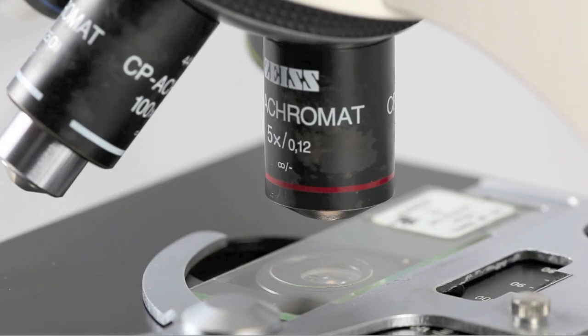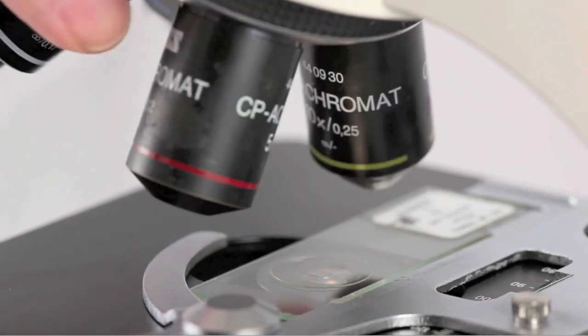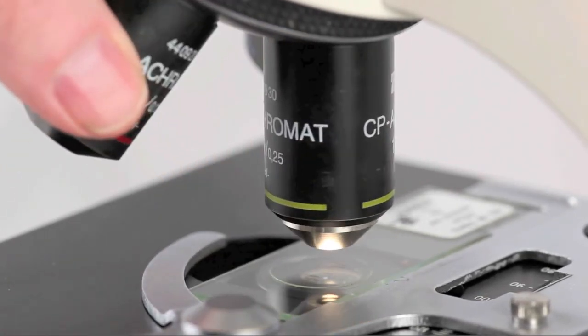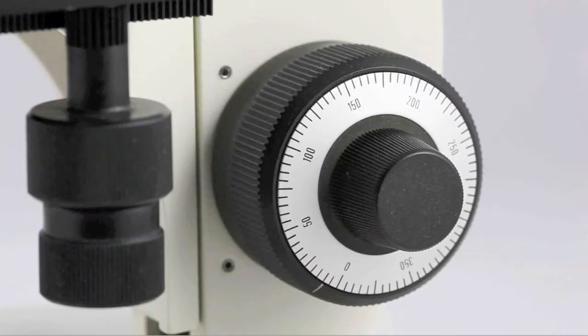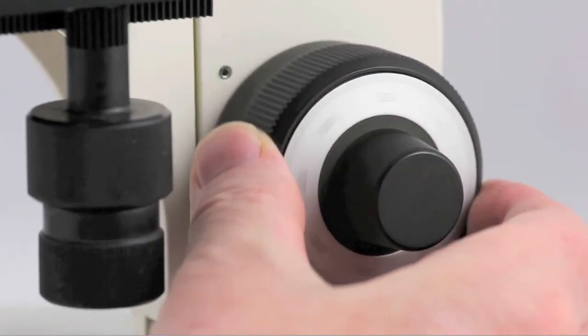Once you have centered and focused the object on scanning, you'll probably want to move on to the low-power objective. You'll need to focus for the low-power objective and probably recenter it as well.